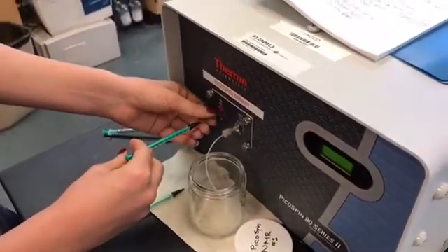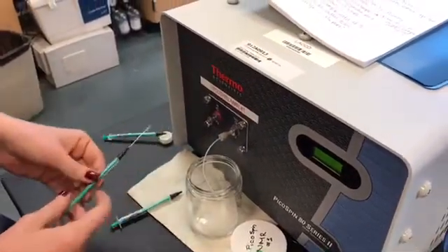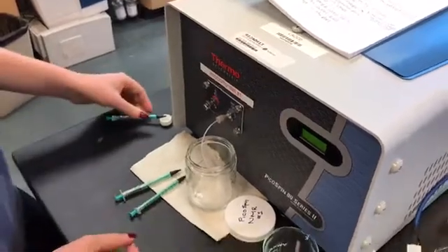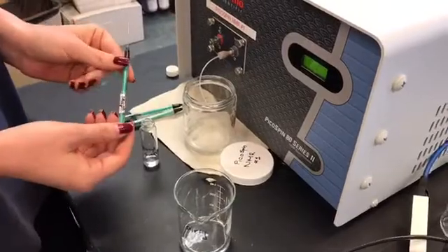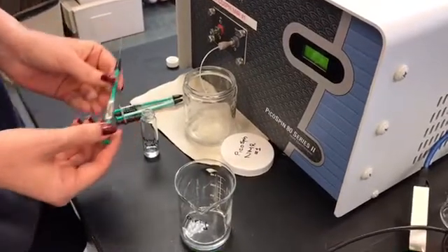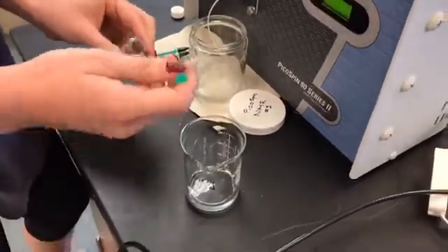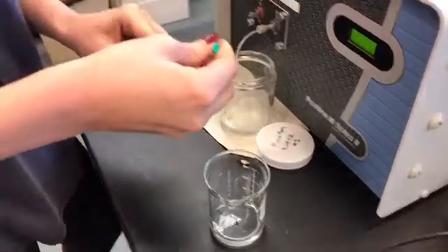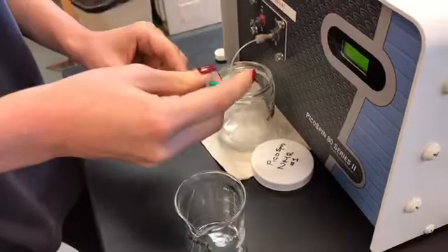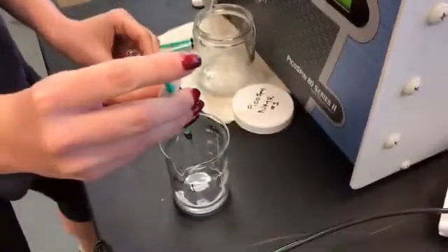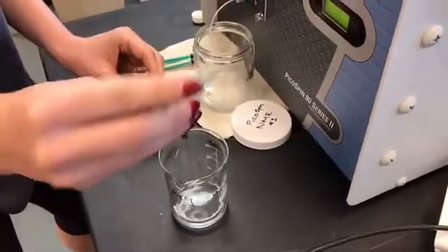You can loosen the screw and remove the syringe, and now you can prepare to put your sample into the NMR. So the next thing you want to do is clean your sample syringe by flushing it twice with your sample. So, I'll take up some sample into the syringe, and then put it in the waste.